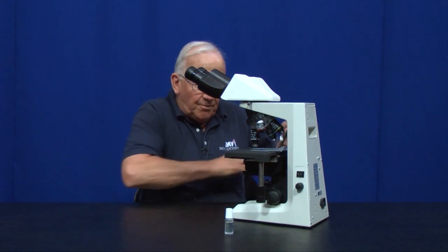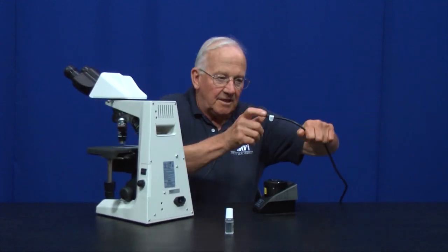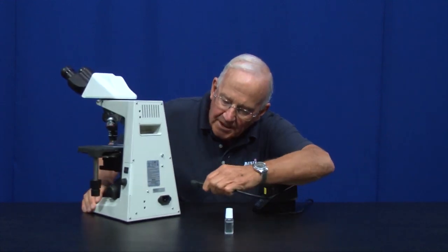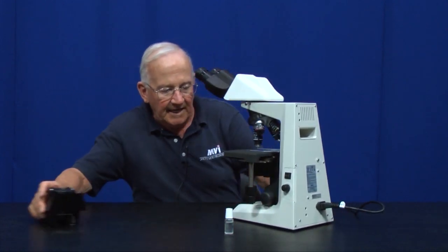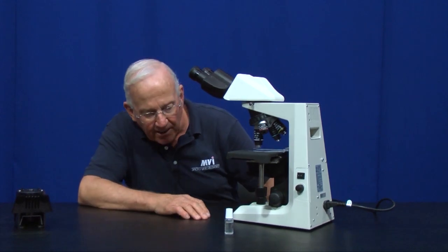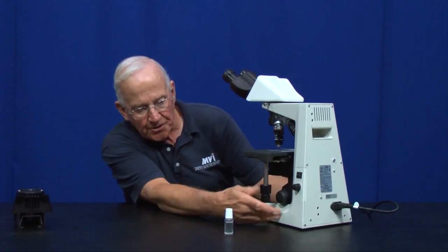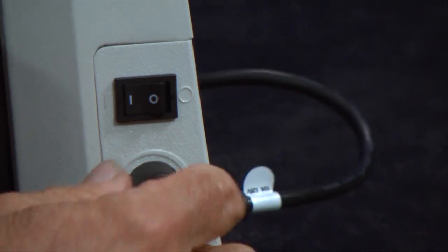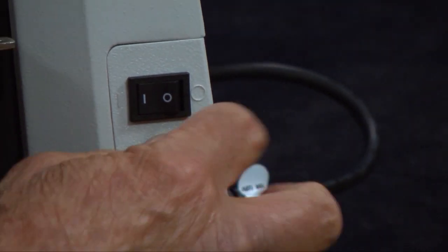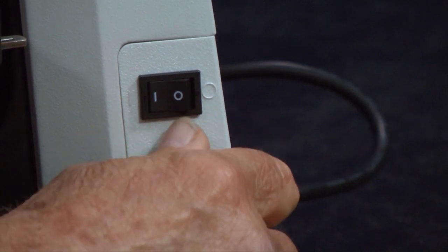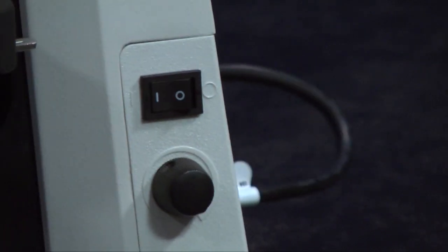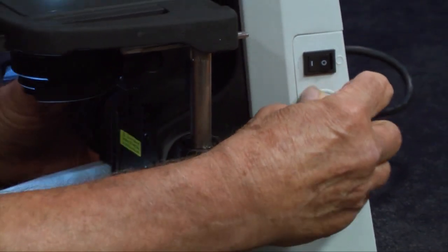Let me show you how you plug the microscope in. The standard three prong cord gets plugged into the back of the microscope like this. I wanted to show you what the light looks like when it's turned on. The on-off switch is right above the rheostat to adjust the brightness. This is the on-off switch and this is the light intensity. You can see the light as I turn the rheostat up and down.